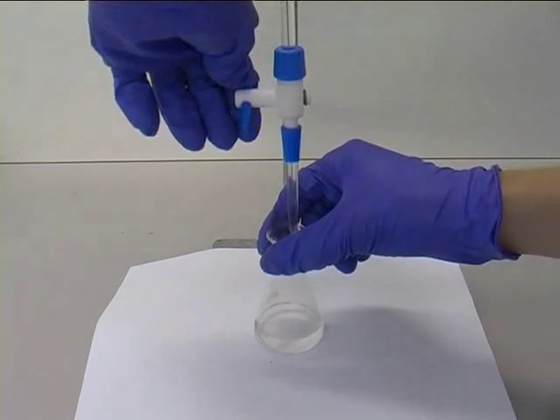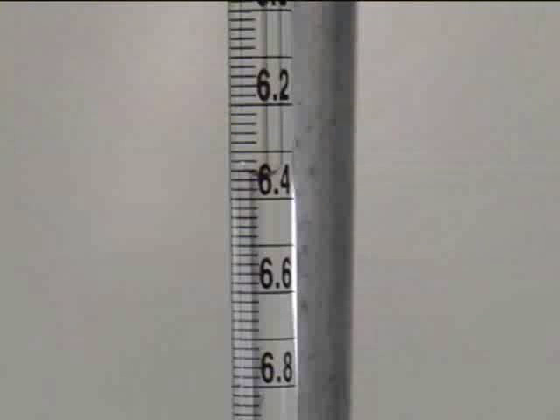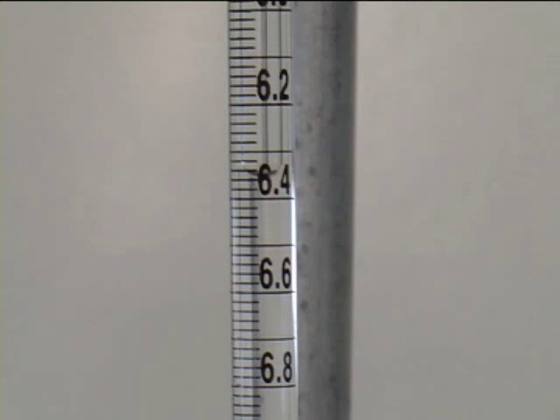There, the end point has been reached and the flow has stopped, giving a rough value.